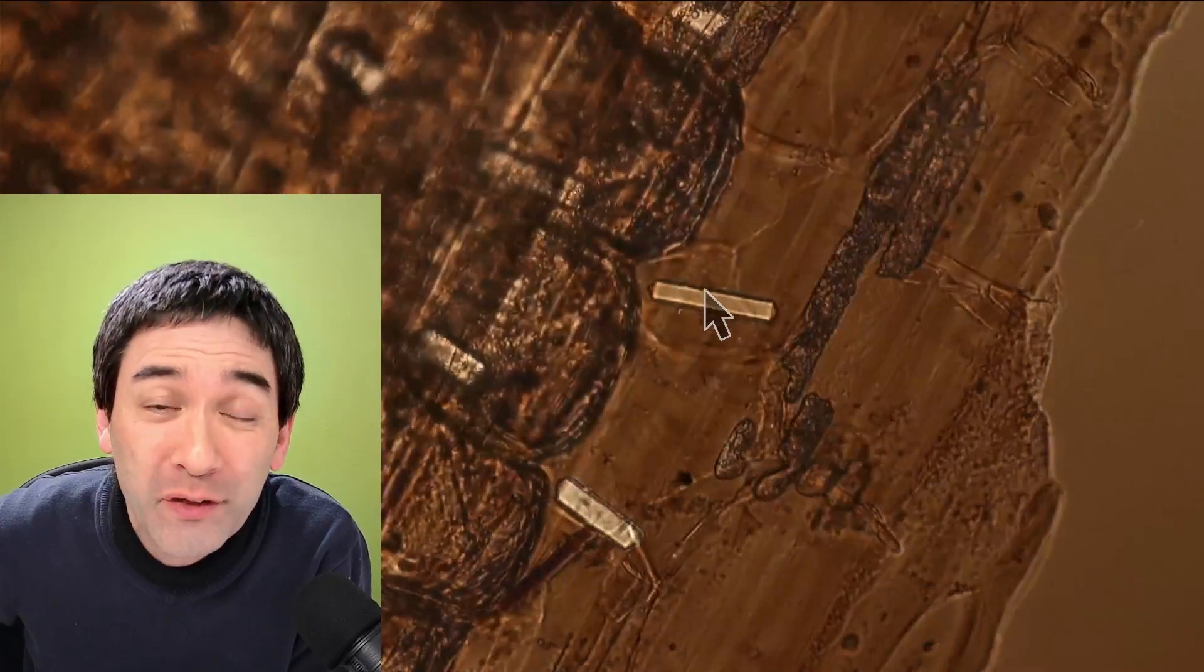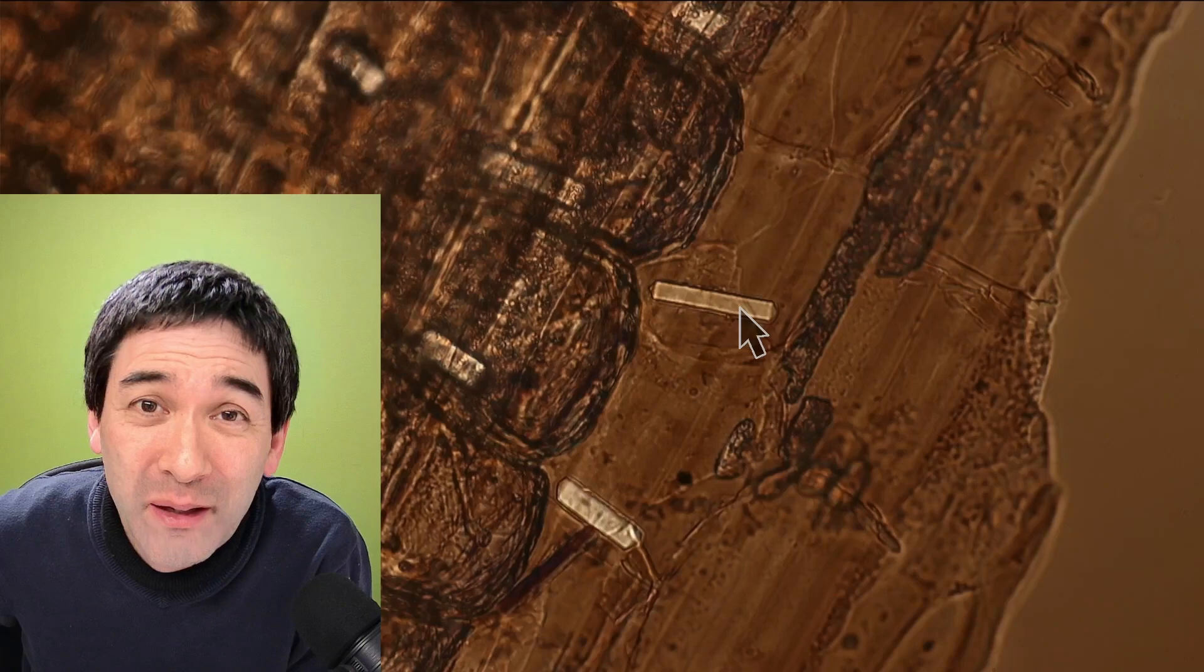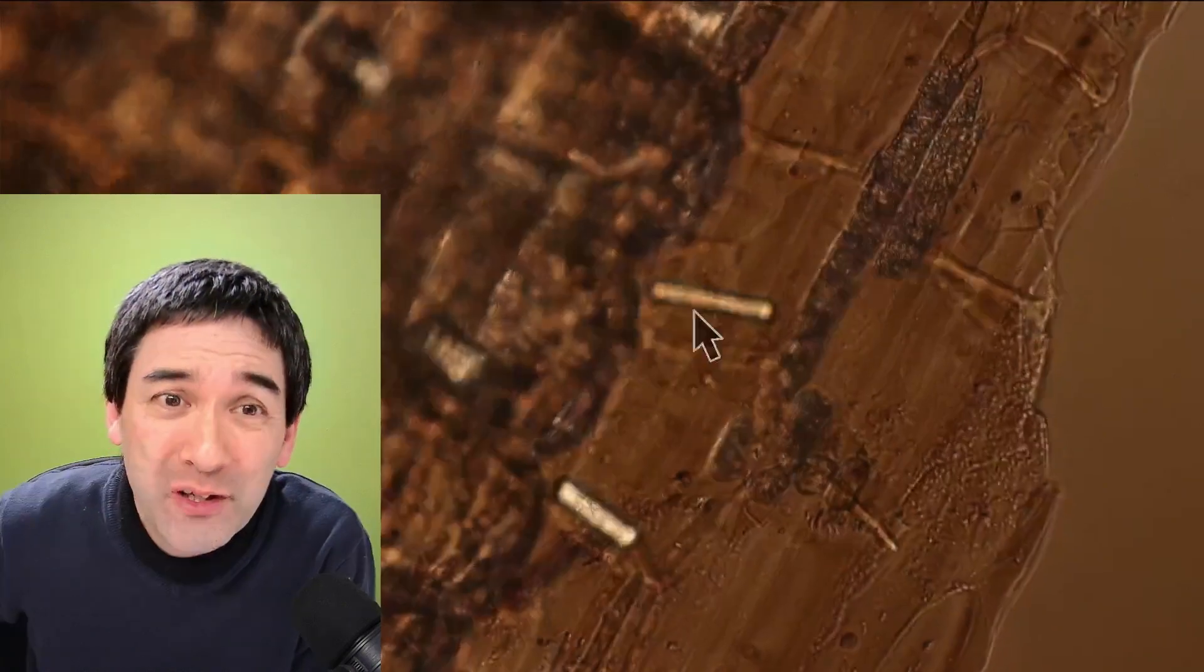The tunic is the outermost part of an onion and today in this video I would like to show you how you can put an onion under the microscope so that you're also able to see those calcium oxalate crystals.